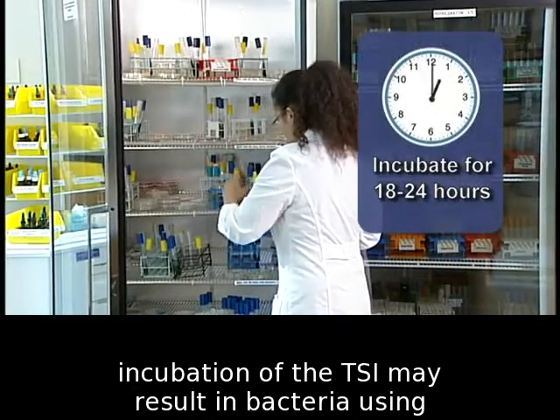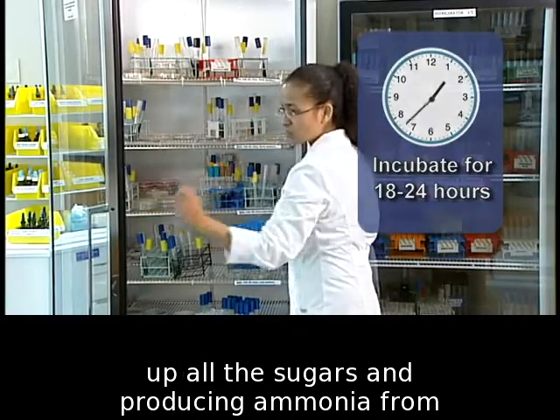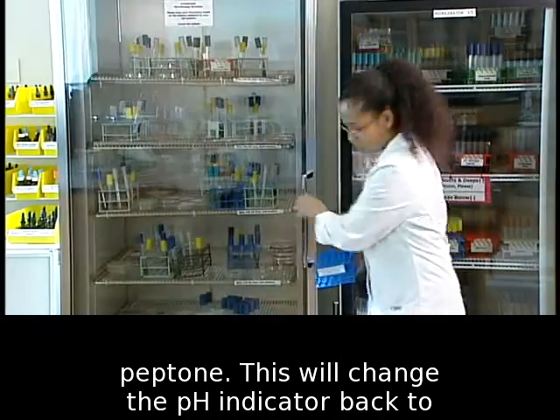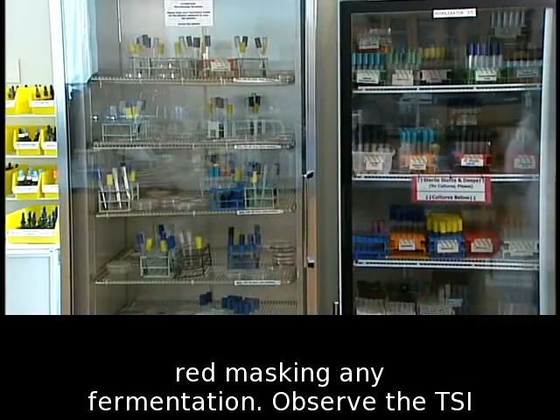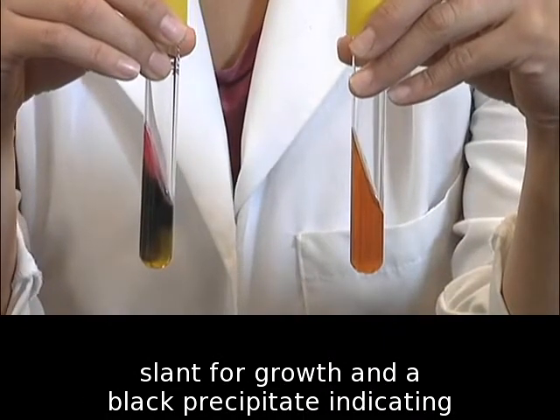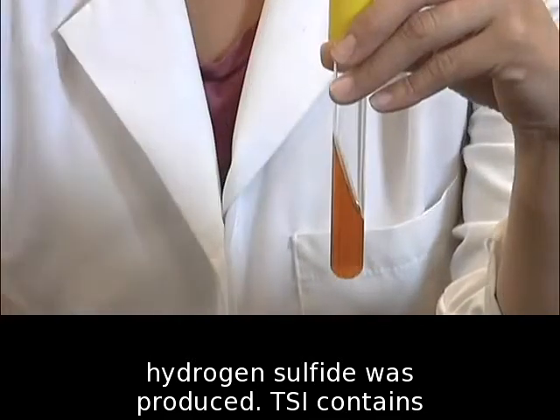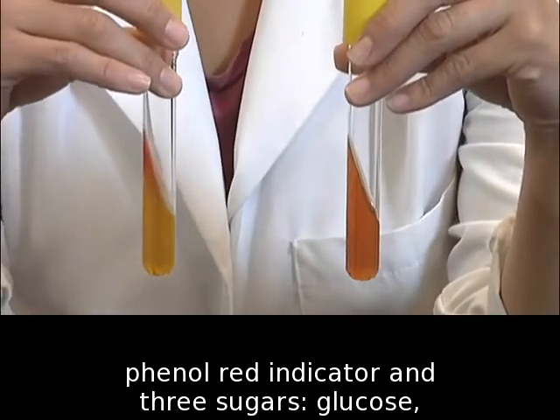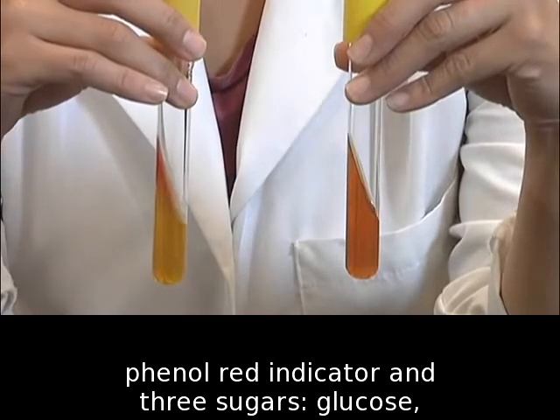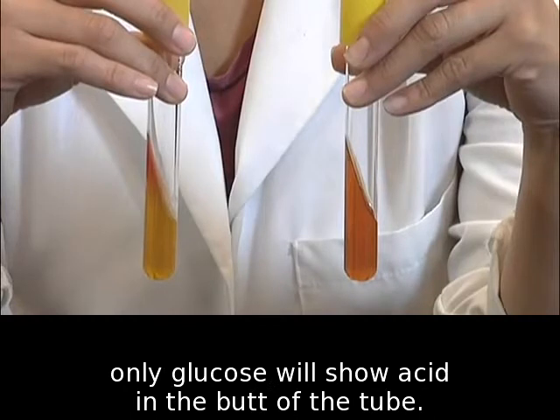Longer incubation of the TSI may result in bacteria using up all the sugars and producing ammonia from peptone. This will change the pH indicator back to red, masking any fermentation. Observe the TSI slant for growth and a black precipitate indicating hydrogen sulfide was produced. TSI contains phenol red indicator and 3 sugars, glucose, lactose, and sucrose. A bacterium that ferments only glucose will show acid in the butt of the tube.